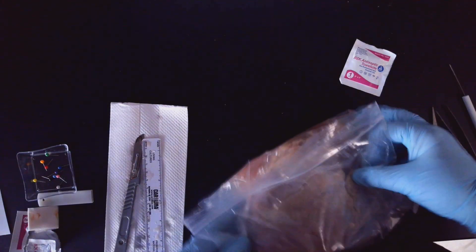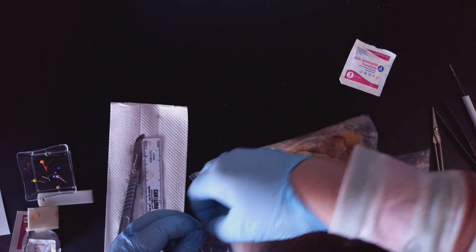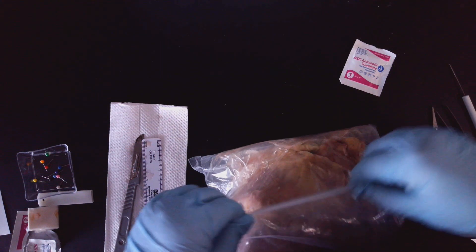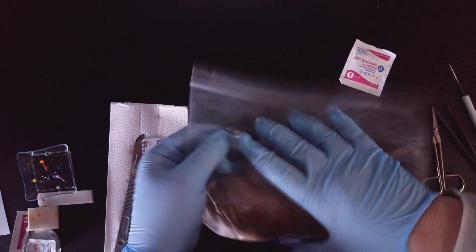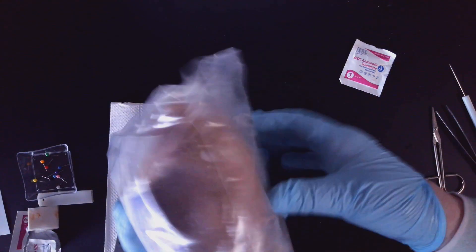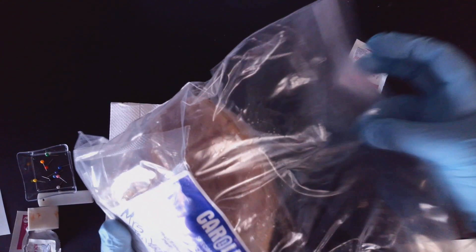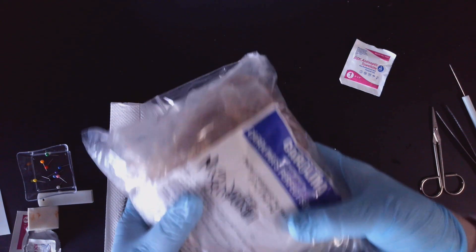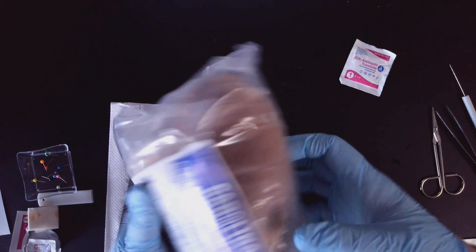Then I'm going to make absolutely sure that this bag is 100% closed up and I'm going to put it in the box that Mrs. Jenkins has available for me. Now if you did not finish, there is a possibility of extending it to the next day, so let Mrs. Jenkins know. She'll tell you where to put this heart instead of in the box. So that's going to go into the box.